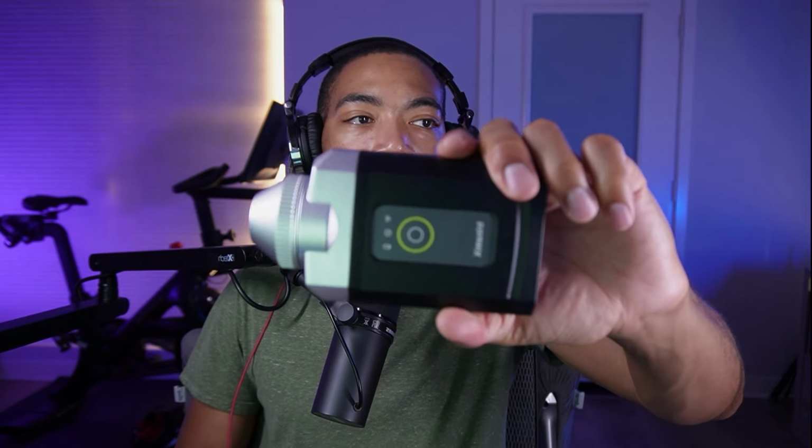Do you want features that look like this or like this? In the last video, I challenged you to think about what statistical test we might run to take our data set of 2,000 features to figure out what is the single most informative feature of our NIR data. So when you have instruments like this that can collect a lot of data, this device can collect 2,000 variables on a sample in a matter of seconds.